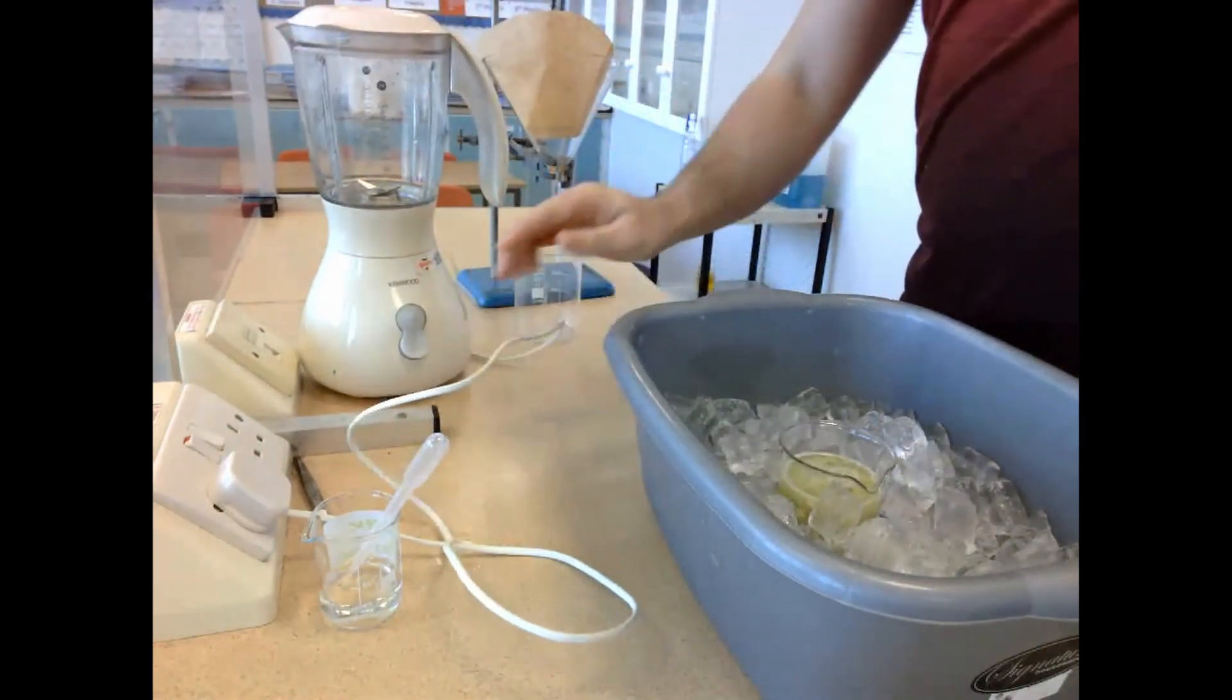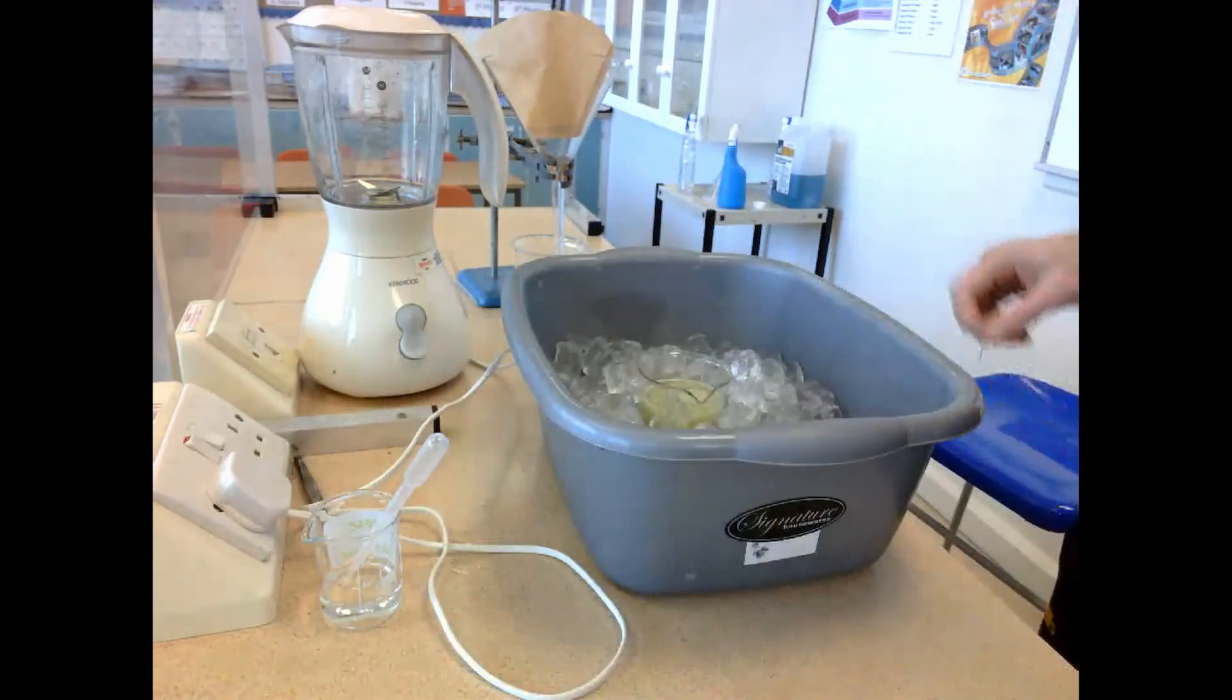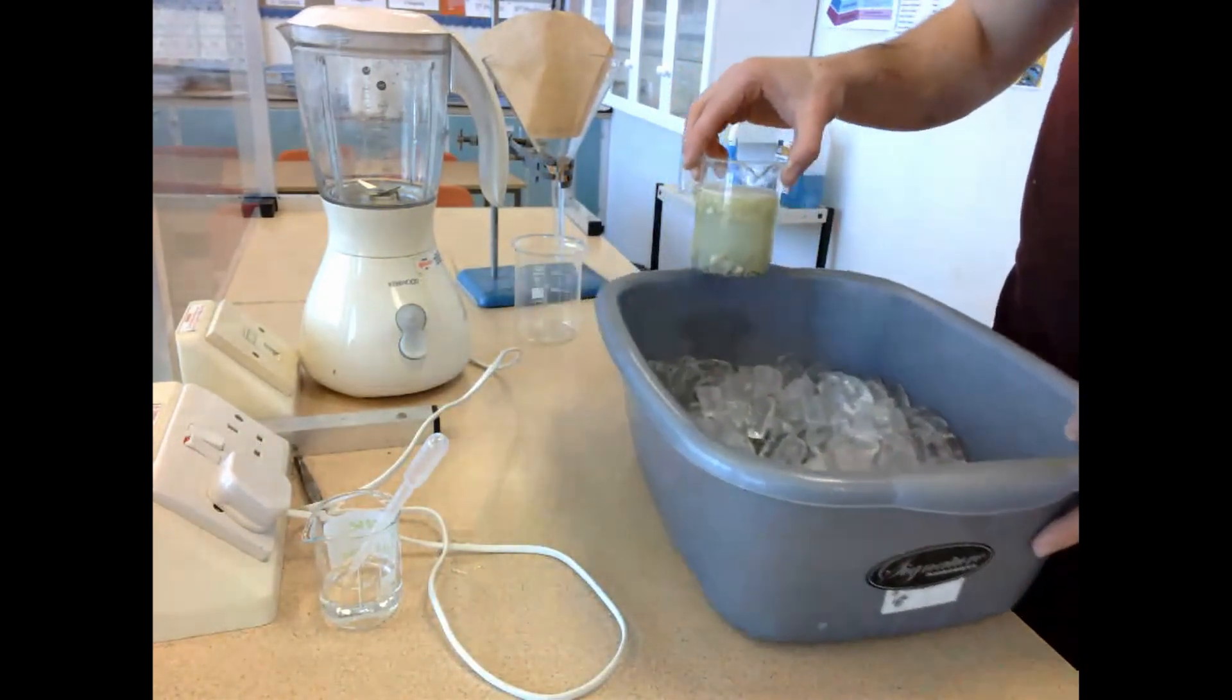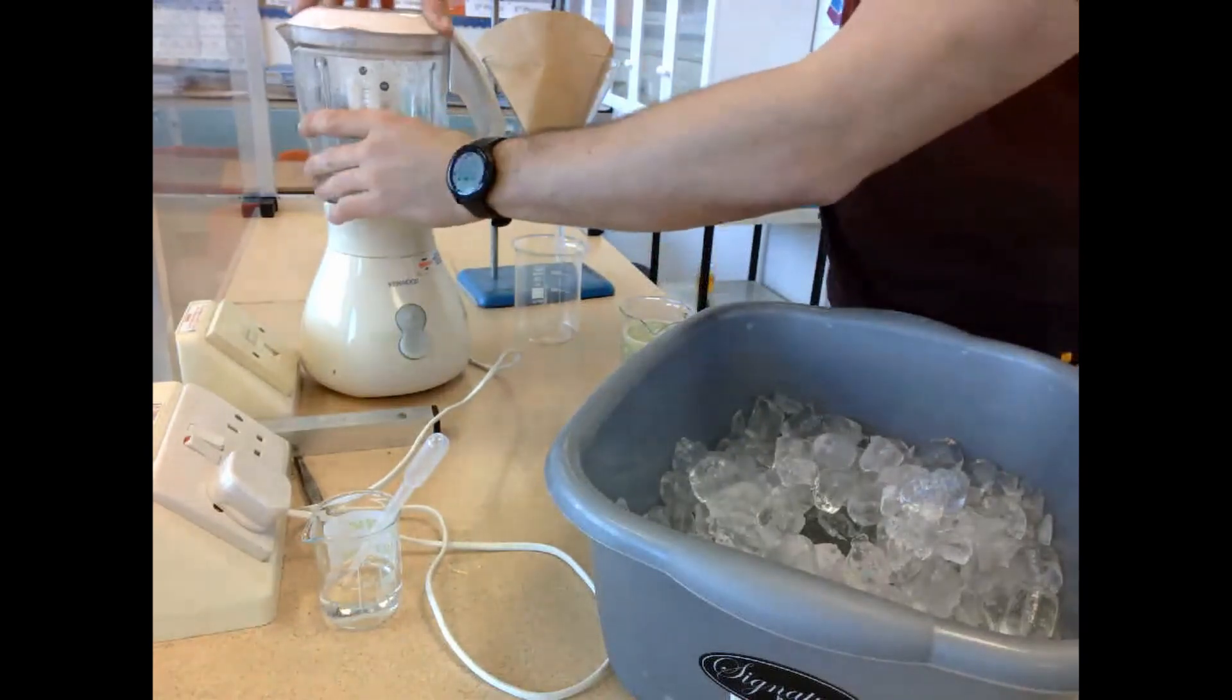Once it's been in there for five minutes, what we're then going to do is we're going to blend the solution. So we get the blender and then we take the solution out of the ice bath and we put it into the blender.